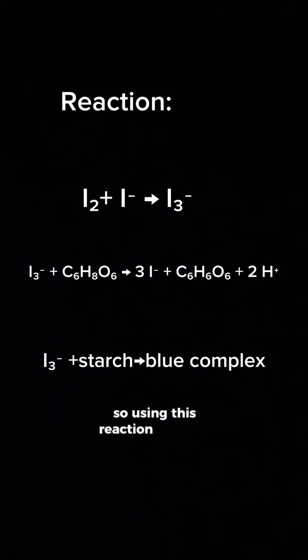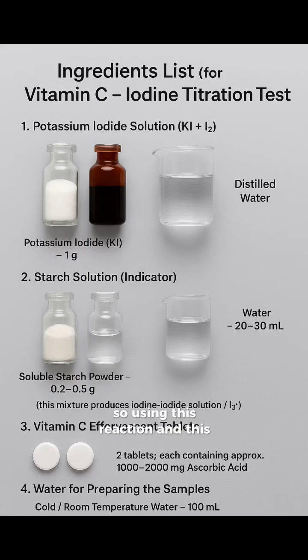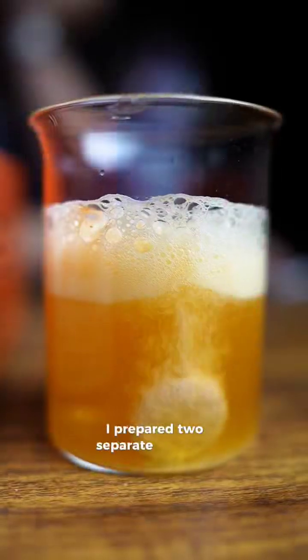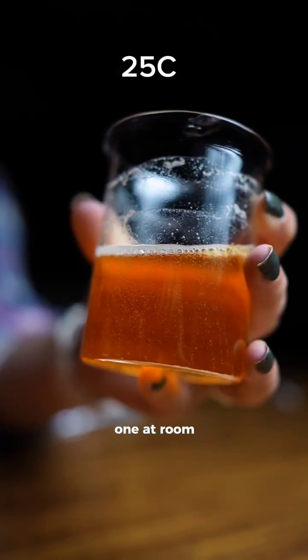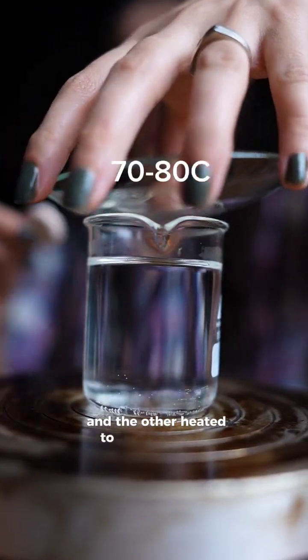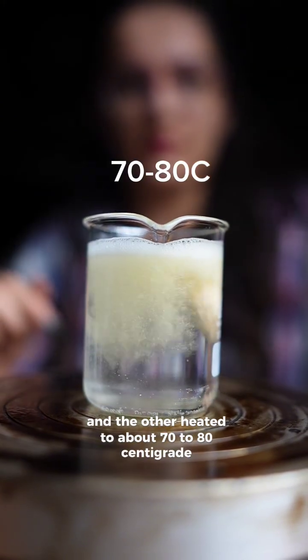So using this reaction and these ingredients I started my test. I prepared two separate solutions, one at room temperature and the other heated to about 70 to 80 degrees Celsius.